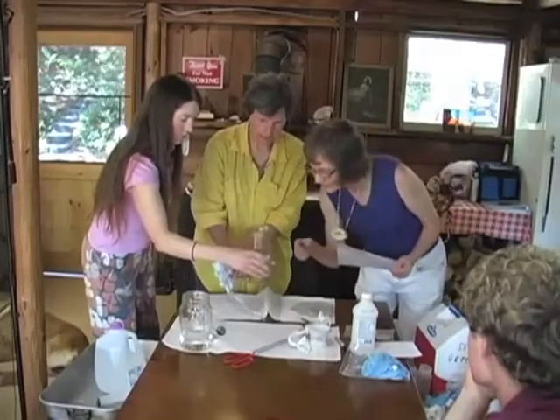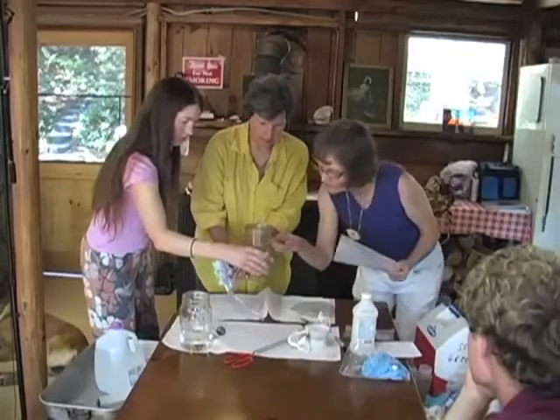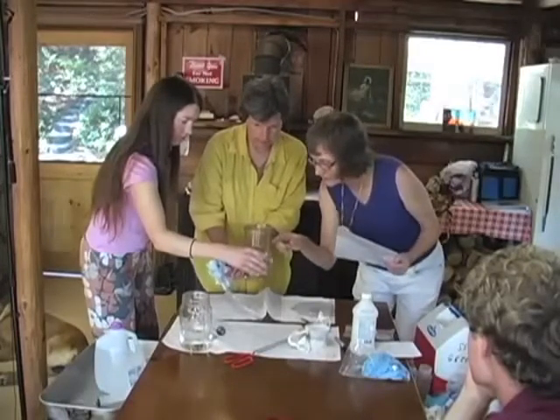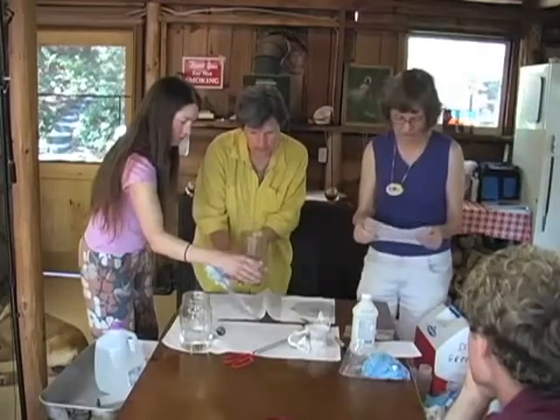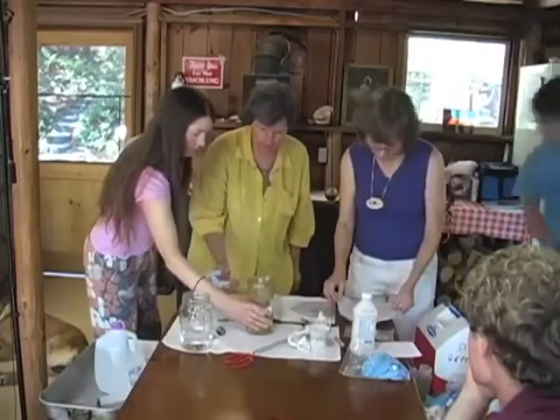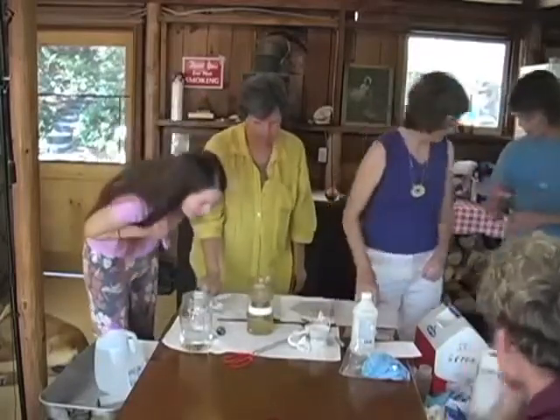Now stop swirling and just a little tiny more till it looks kind of dry. If it's starting to feel dry, we don't want to tear it, so I'd say that's good. Okay, so, it does look a little crowded.